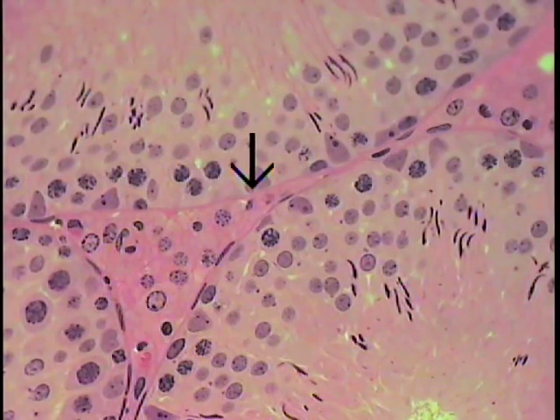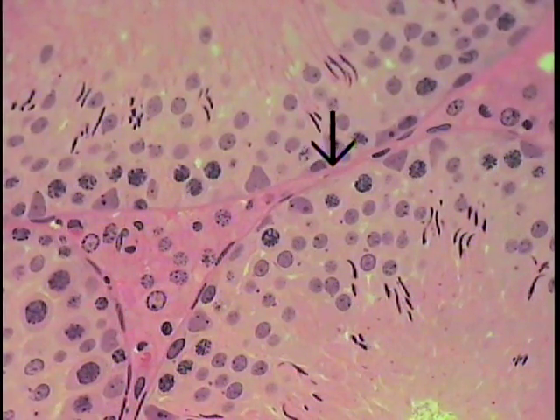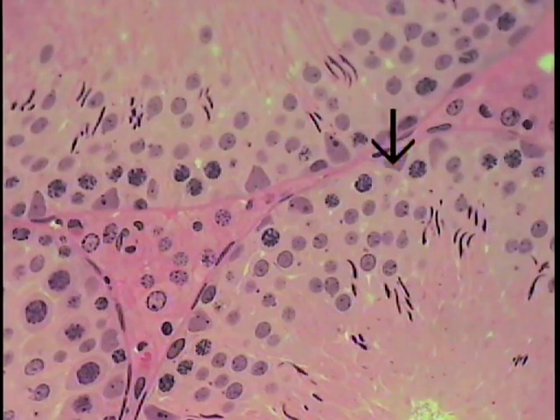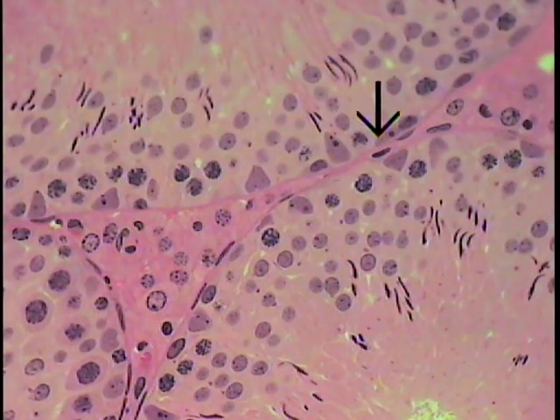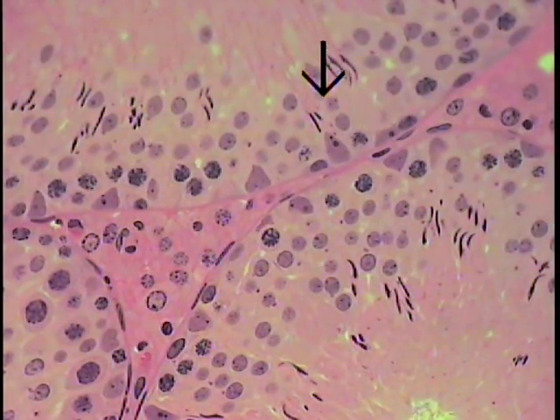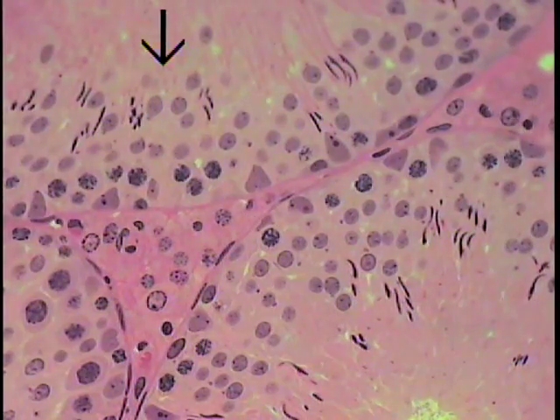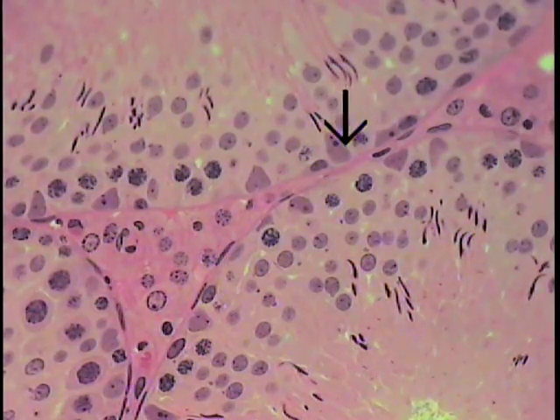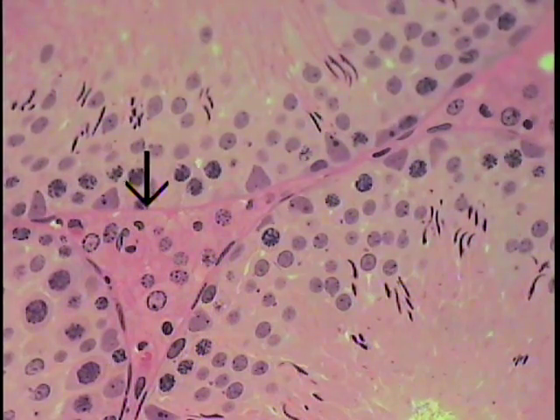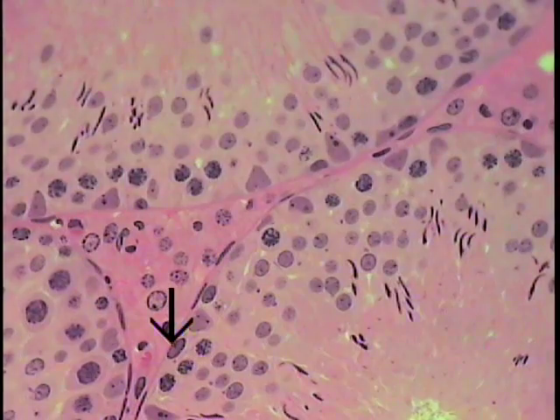So that is the supporting framework — these Sertoli cells are the supporting nurse cells. Now in between Sertoli cells, running along their lateral borders as shown here, we have the spermatogenic cells. The spermatogenic cells divide here and then migrate along the lateral surfaces of the Sertoli cells. With very careful observation, one can see some of the germ cells — the beginnings. These are spermatogonia here, hugging the basement membrane, and sort of have this oval-shaped character to them. So this would be a spermatogonium.